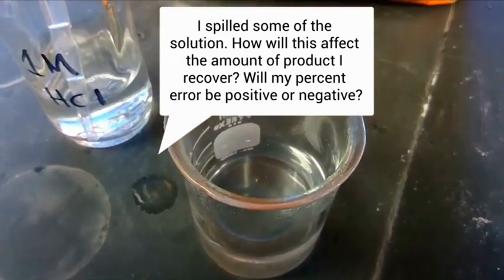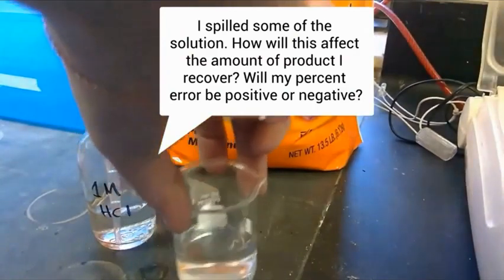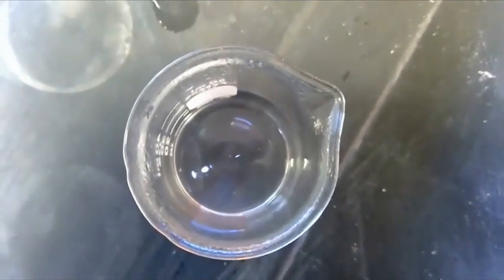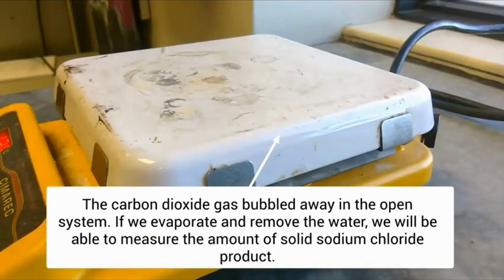You may notice I have a procedural error there. I spilled some of the solution. How will this affect the amount of product I recover? Will that make my percent error positive or negative? I may need to write an error analysis.